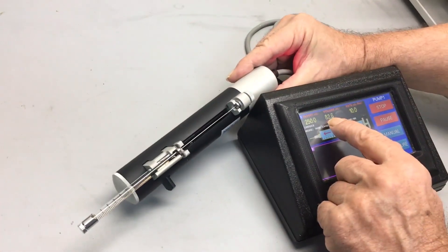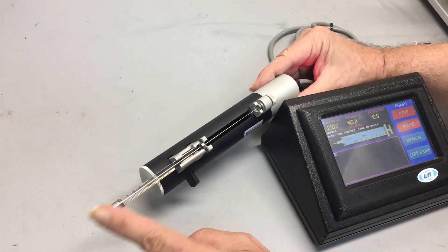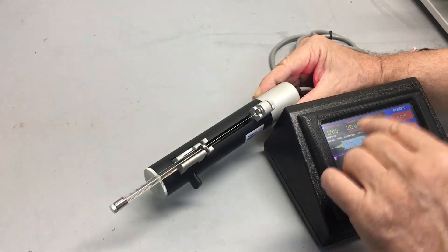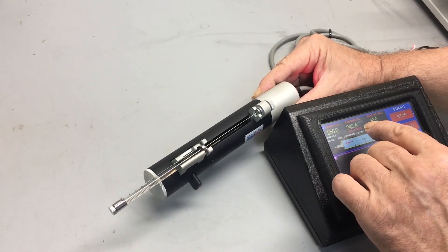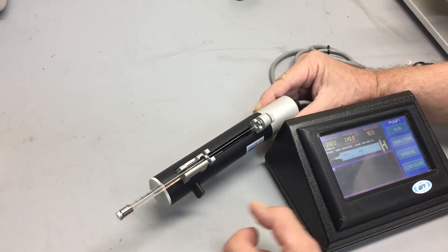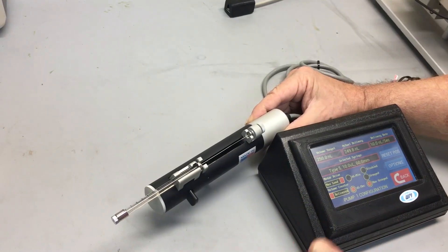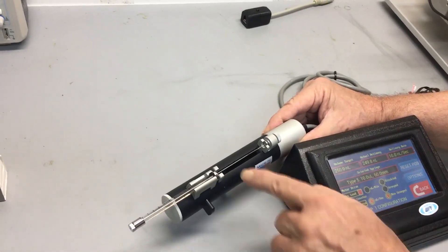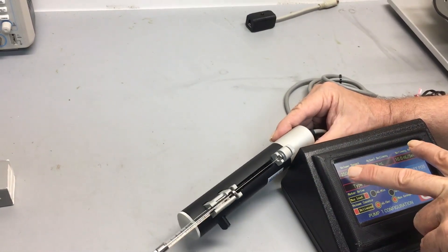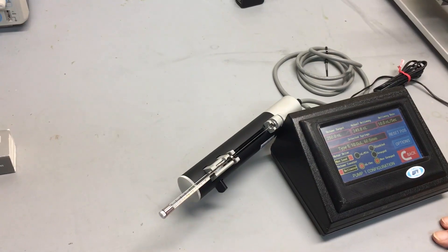The volume counter is basically showing you that it is delivering the volume. Since I primed the needle and there are no air bubbles in there, this is a completely non-compressible fluid injection. So when it says I delivered 250 nanoliters, it did deliver 250. If there was an air bubble in there, the volume is in question. I can change the delivery rate and the target volume back and forth — the machine knows exactly where the full mark is and the zero mark is.